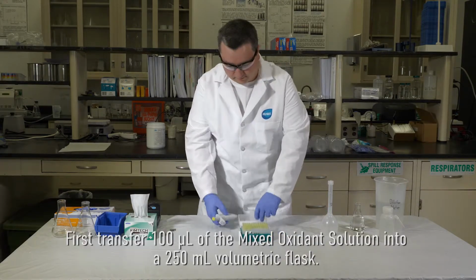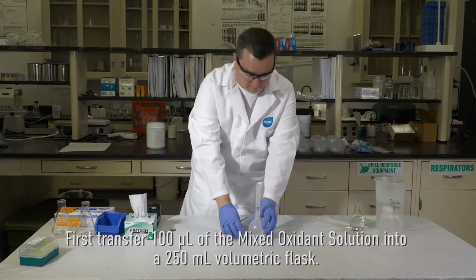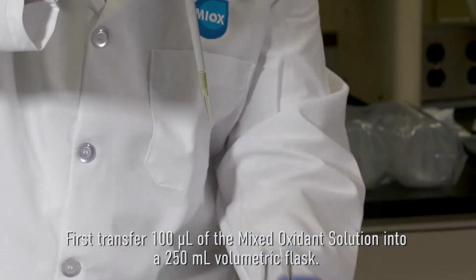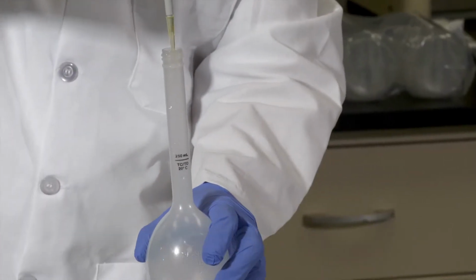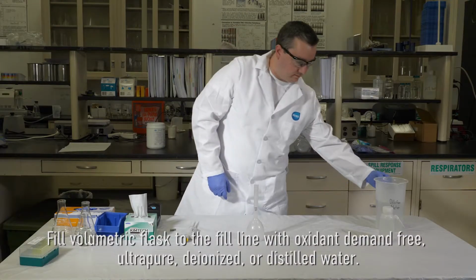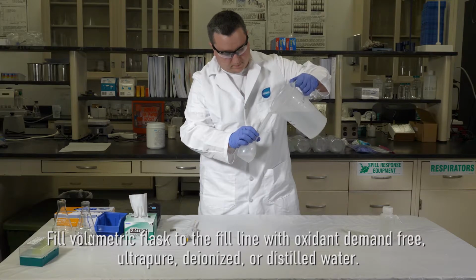First, transfer 100 microliters of the mixed oxidant solution into a 250 milliliter volumetric flask. Fill the volumetric flask to the fill line with oxidant demand-free, ultrapure, deionized, or distilled water.